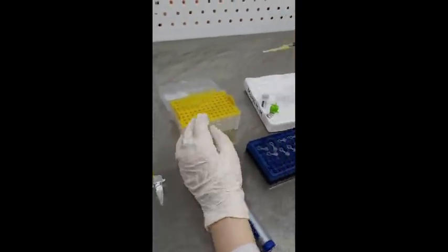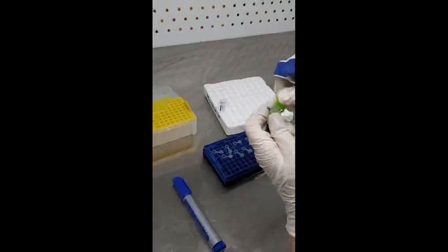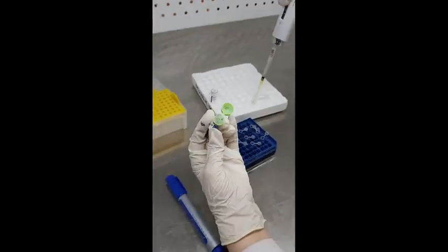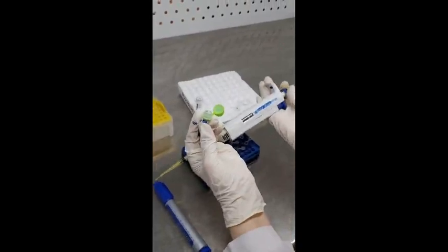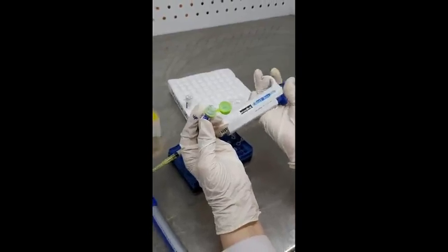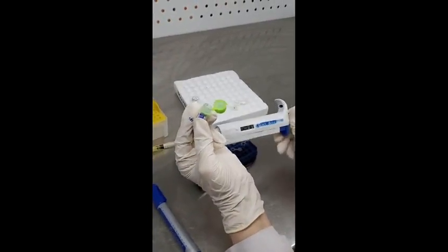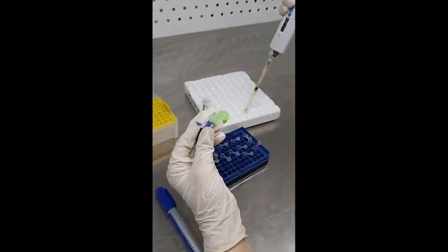In this particular video we are running 11 PCR reactions. For one reaction we usually need 12.5 microliters of the master mix, so for 11 reactions we are adding 137.5 microliters to the large tube.